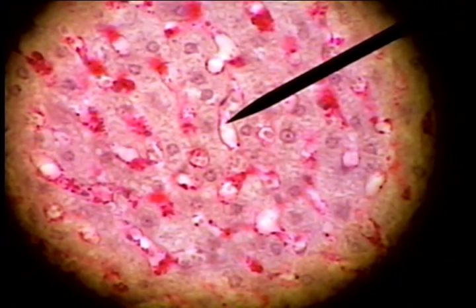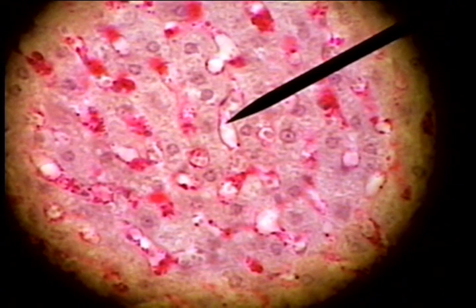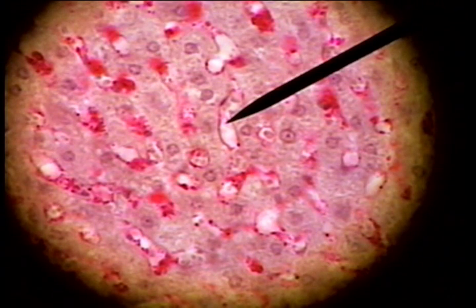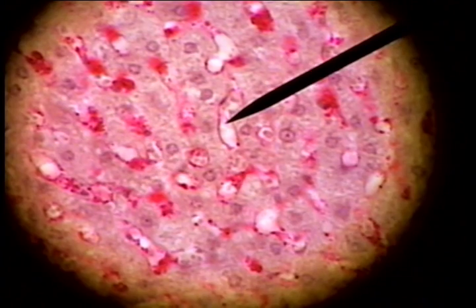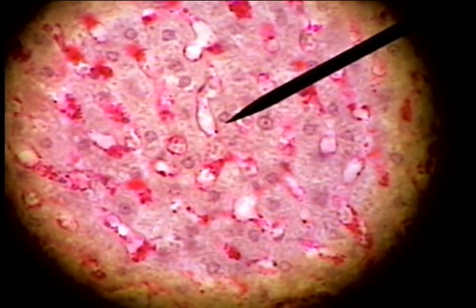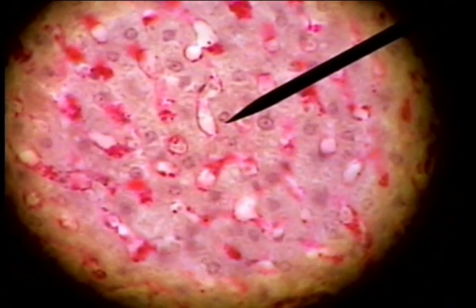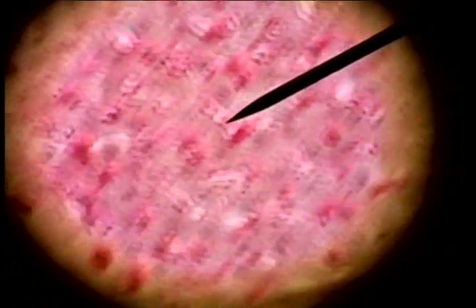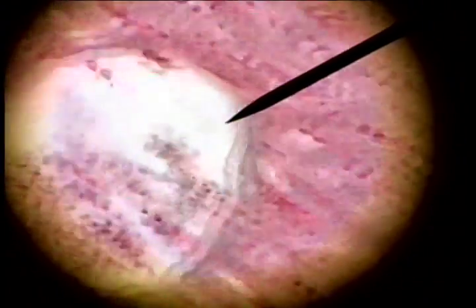are the hepatic sinuses, and these sinuses, or sinusoids, is where the blood that's being processed comes to the liver cells for their biochemical action upon that substrate.